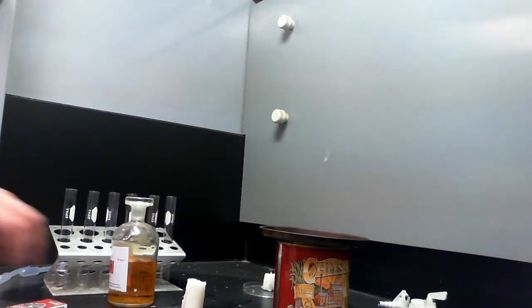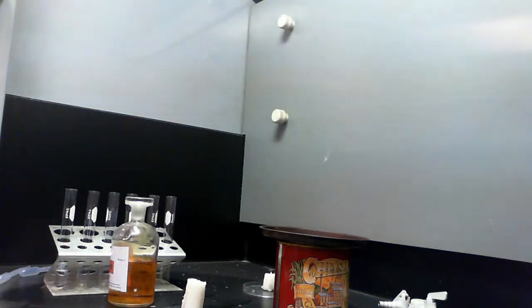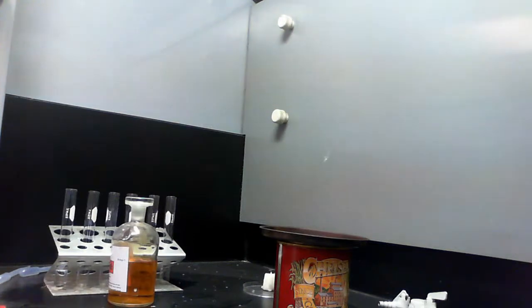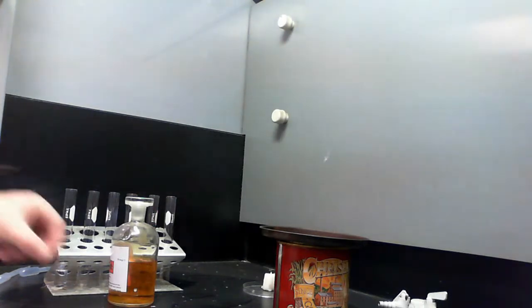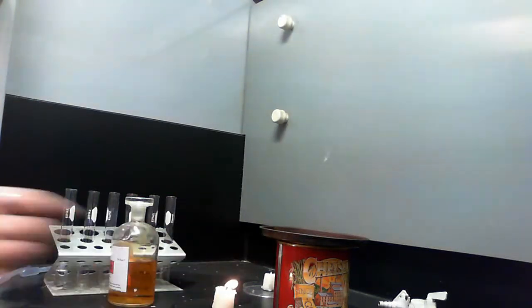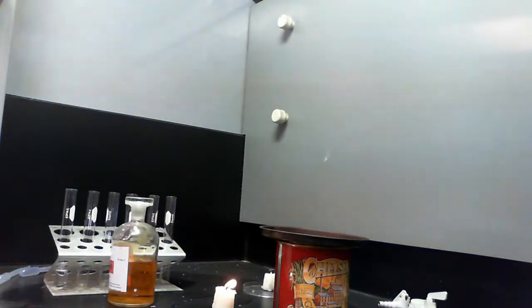Alright, just to sort of reinforce the point, we'll light a candle. And you'll see that that also is not going to give a completely colourless flame, a blue flame. I'm sorry I'm lighting that out of screen, but the fume cupboard's putting everything out. So, alright, and so what we're seeing now, we're starting to see the alkane burning. To start with, just the wick. But now we're starting to see that burning.